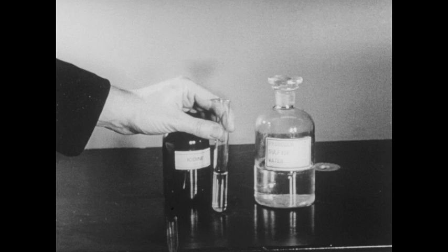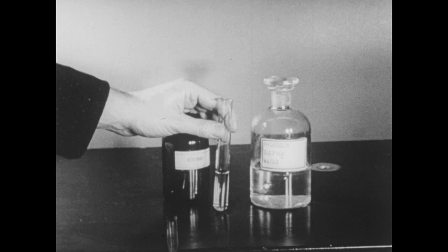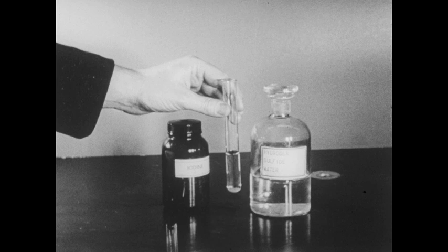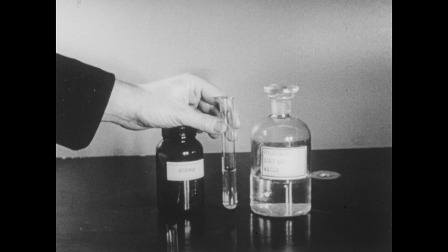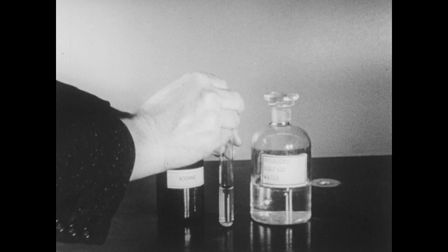A solution of hydrogen sulfide gas in water is called hydrogen sulfide water. This liquid has been prepared by bubbling a steady stream of hydrogen sulfide gas through distilled water. This solution is very useful; we will illustrate a number of its reactions. One of the properties of hydrogen sulfide water is its activity as a reducing agent, so we'll try it with a number of different oxidizing agents.